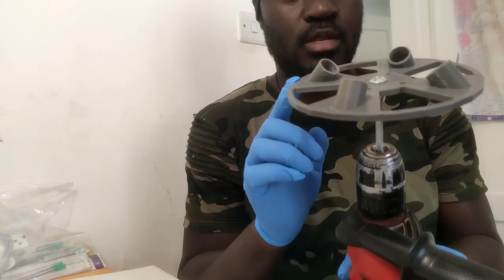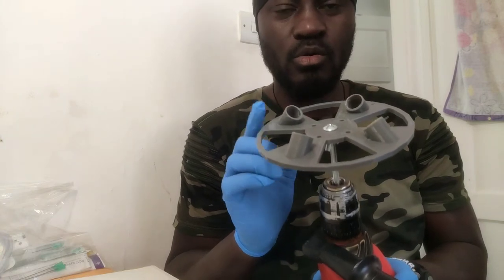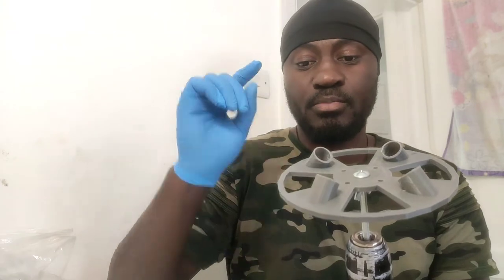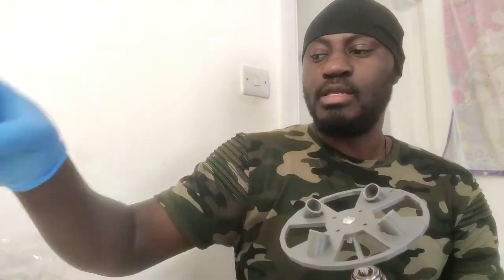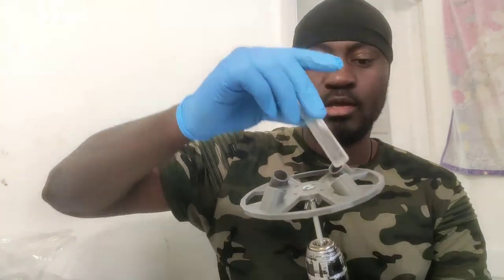This was 3D printed. This one is a 3D print that I found online somewhere — an STL file — and I printed it out. And I used the drill to widen it a little bit, because initially I was using this one that could fit in easily, and then I bought this one which is a little bit bigger.